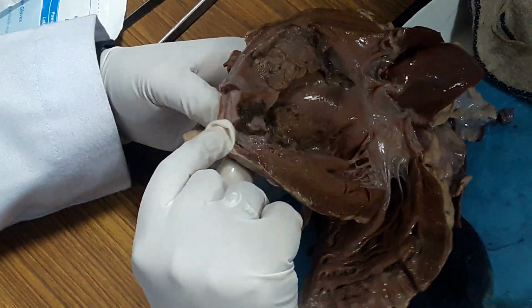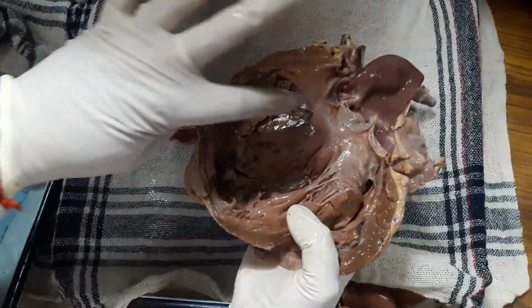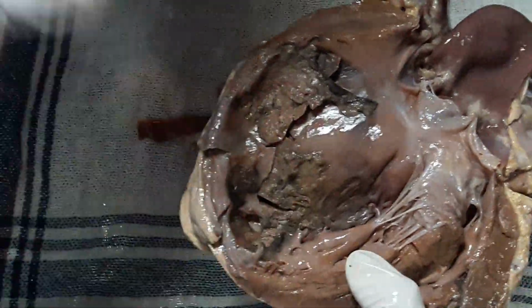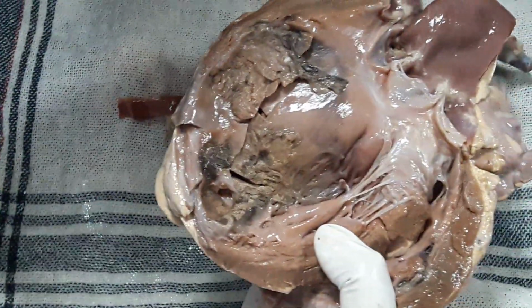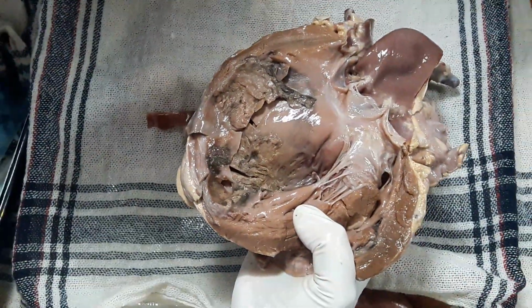Wall is showing some whitish scars also. So this patient had repeated infarction. Thrombus is in the lumen. The dark one is the infarcted area. The irregular one is the luminal thrombus. Thrombus will be there in the lumen. Okay, the endocardium will be denuded, and on the top of the endocardium you will see thrombus formation.